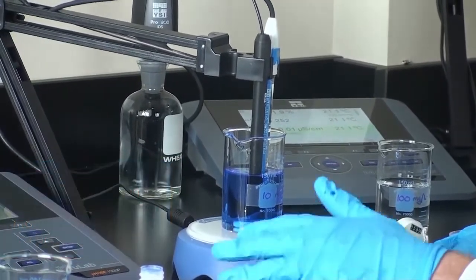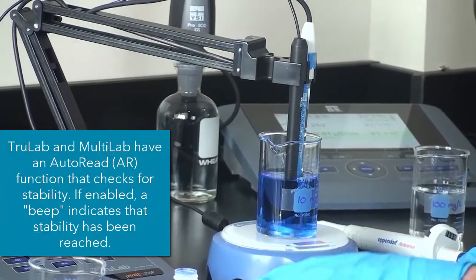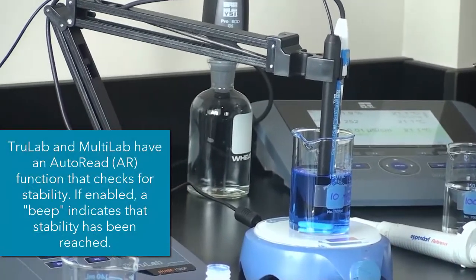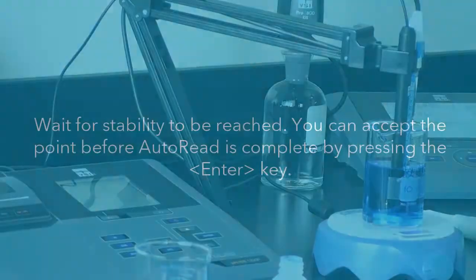So then we will let that stabilize there and then we can begin our calibration procedure by pressing enter. So what the TruLab will do is it will wait until the reading is completely stable before telling you to move on to the next point. So what it will do is it will beep at us here in just a few, telling us that we are ready to move on.